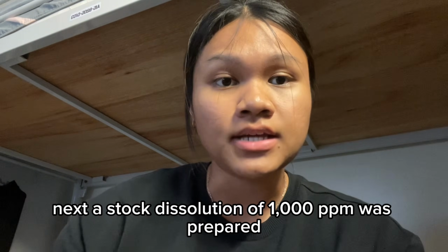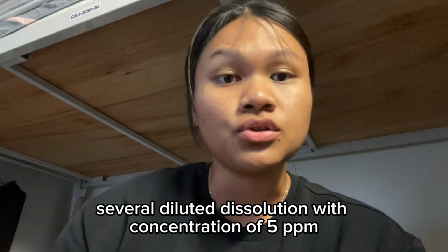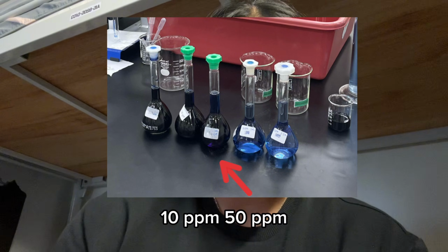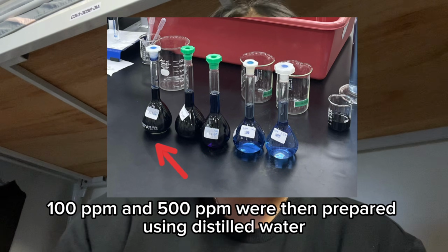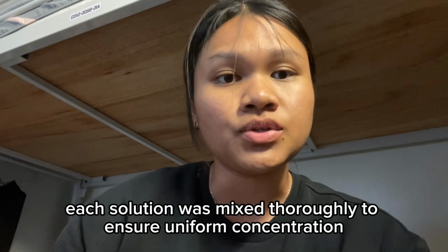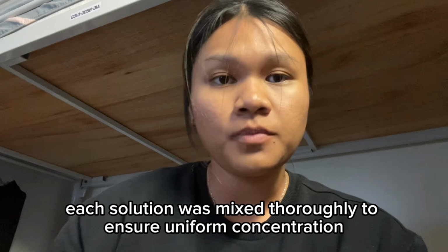Next, a stock dye solution of 1000 ppm was prepared. Several diluted dye solutions with concentrations of 5 ppm, 10 ppm, 50 ppm, 100 ppm, and 500 ppm were then prepared using distilled water. Each solution was mixed thoroughly to ensure a uniform concentration.